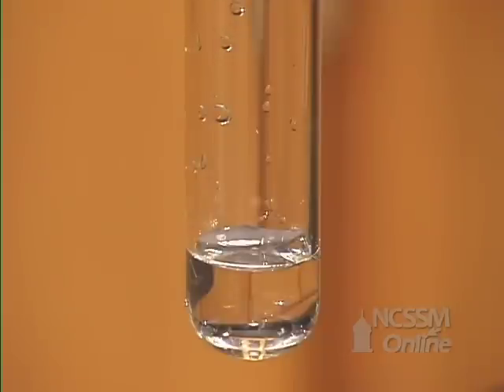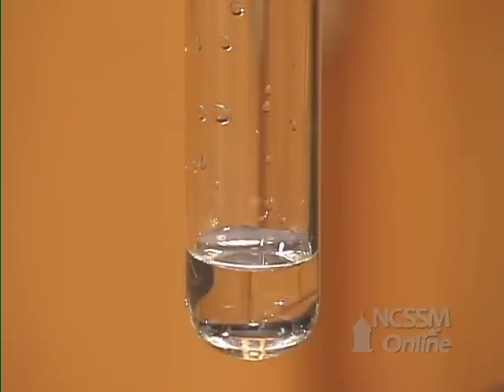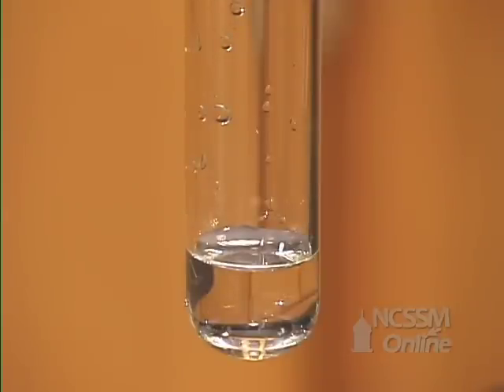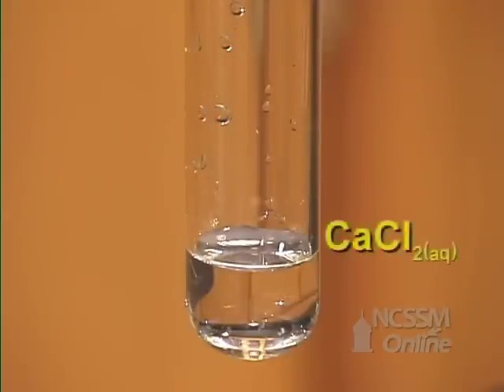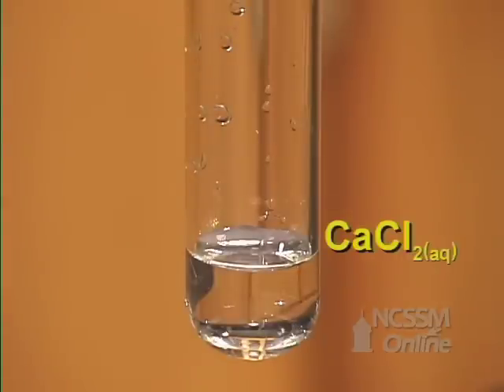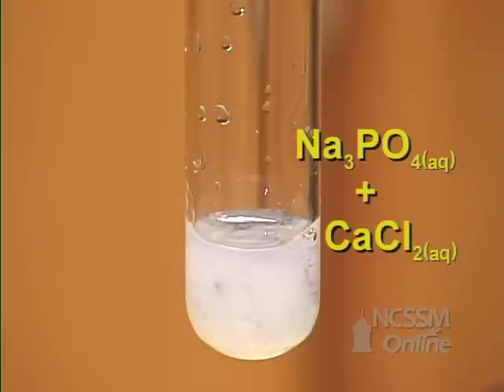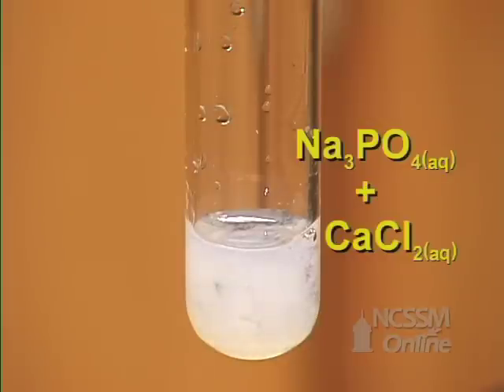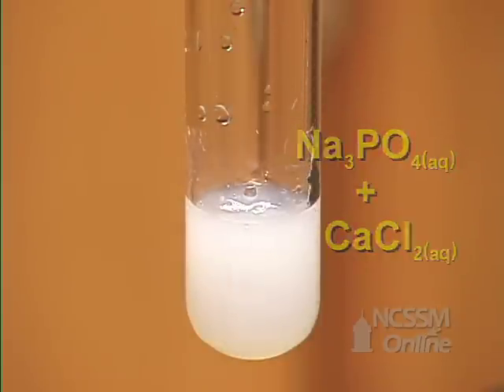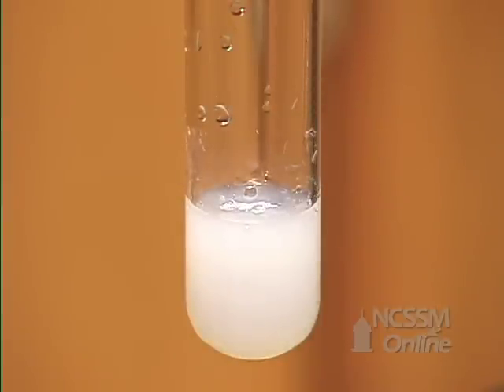In the double displacement reaction of calcium chloride and sodium phosphate, we have a colorless solution of calcium chloride. We will add a colorless solution of sodium phosphate. When we add the sodium phosphate to the calcium chloride, we get the rapid formation of a white precipitate. The precipitate is calcium phosphate.